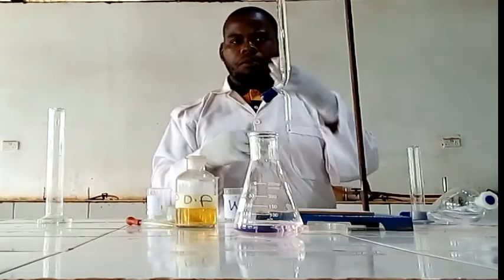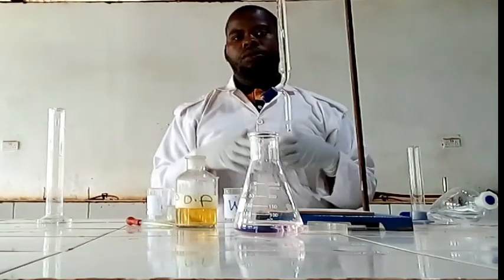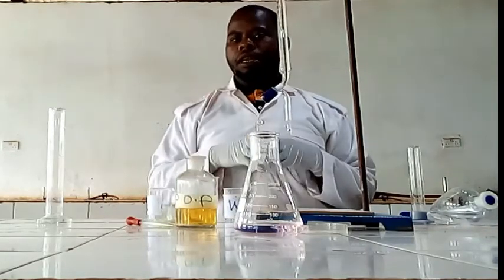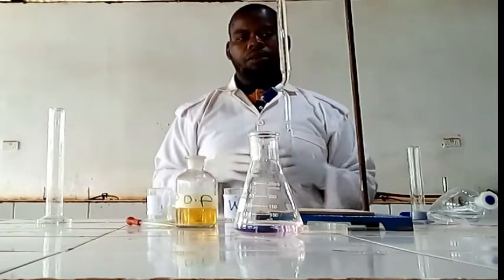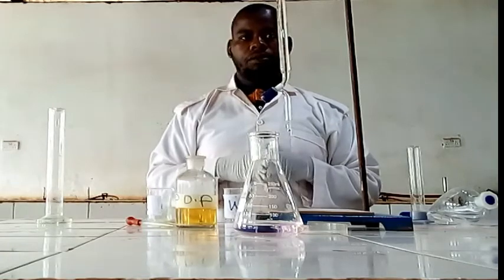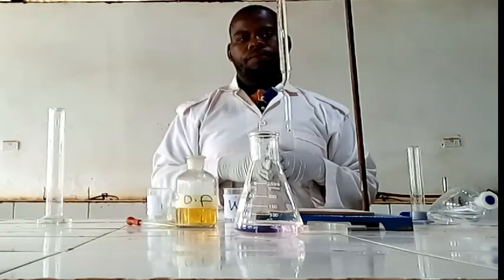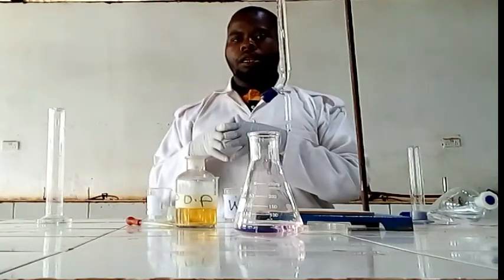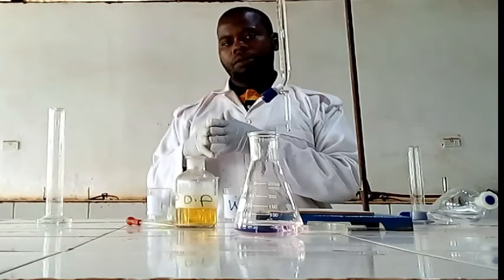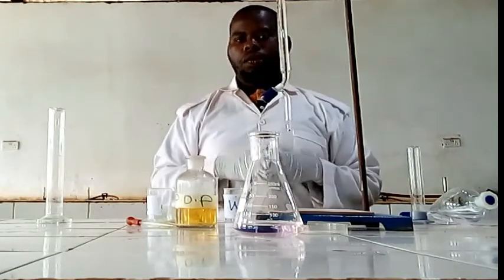We have a form of questions. So this is the first experiment. We will see another experiment, number 1, number 2, even number 3, and then number 4. I think you have seen how to perform titration with the partition experiment through distribution laws, organic solvent with water. I think enough. Let's go to calculations.